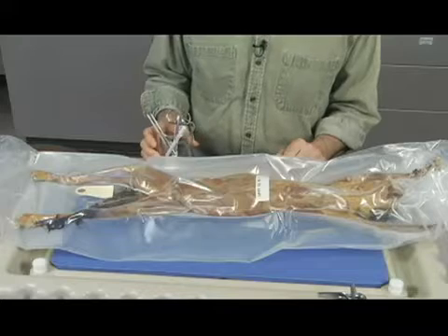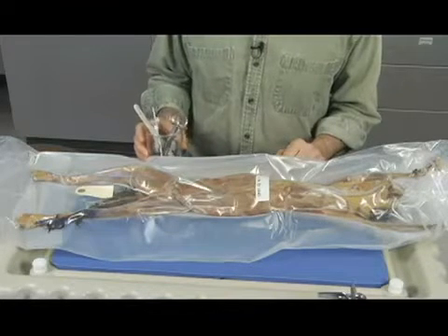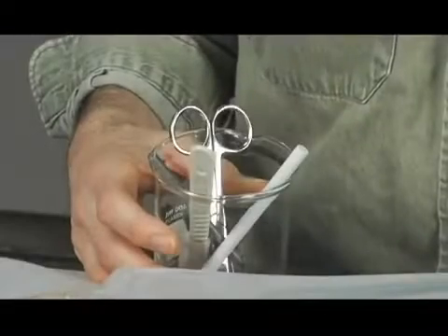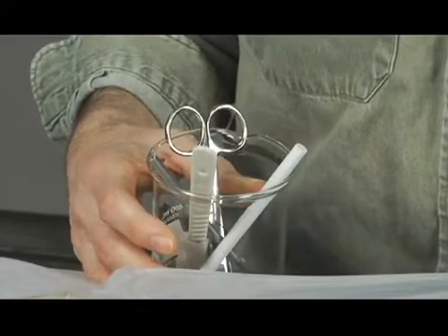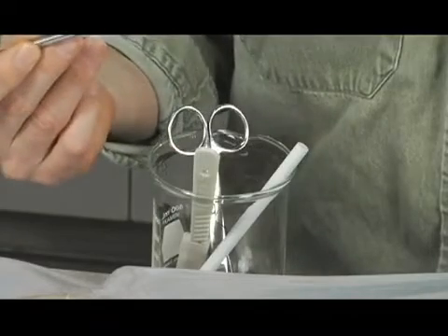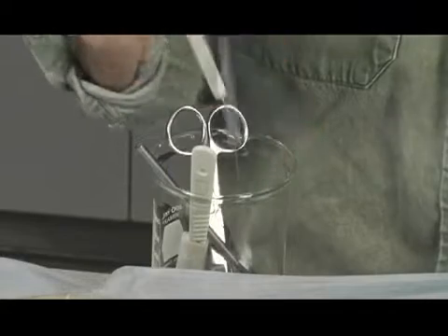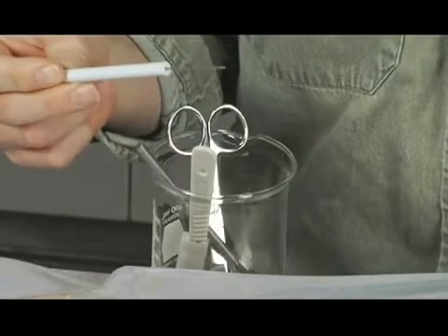Okay. The other thing we want to look at here are some of the utensils that are going to be used. We're only really going to need a few, and I've got them in this little beaker here, and I wanted to go over each one with you. Start with this one. This is a blunt probe. This is a sharp probe, and it's basically something that's got a very pointed end to it.